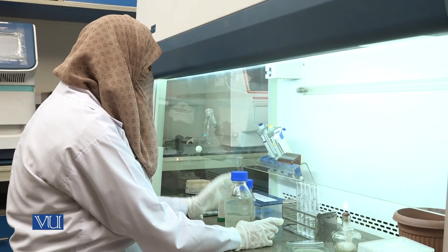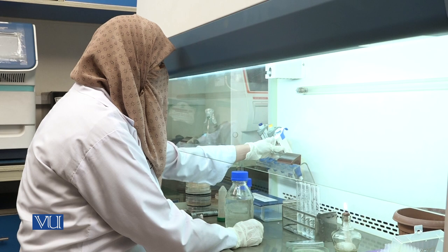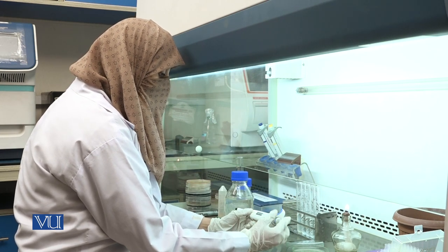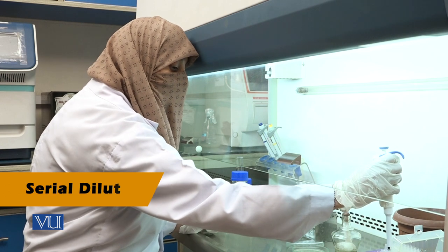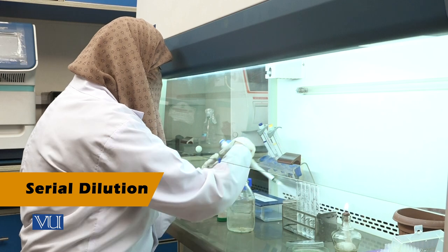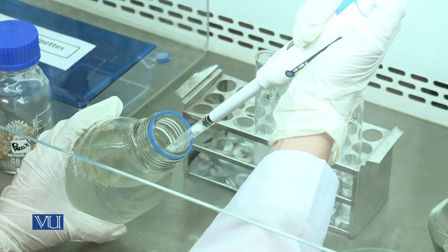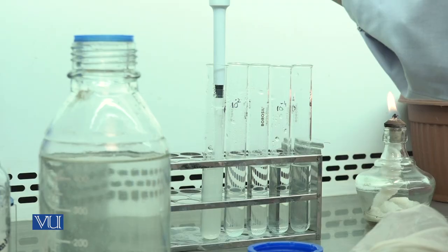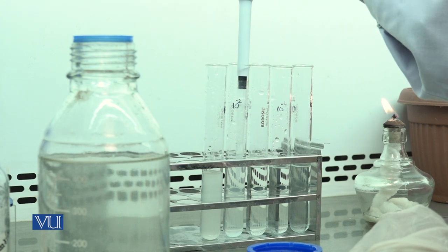After fermentation, make 5 serial dilutions from the fermented pearl millet. For serial dilutions, take 1 ml of fermented pearl millet solution and dilute it to 5 serials.